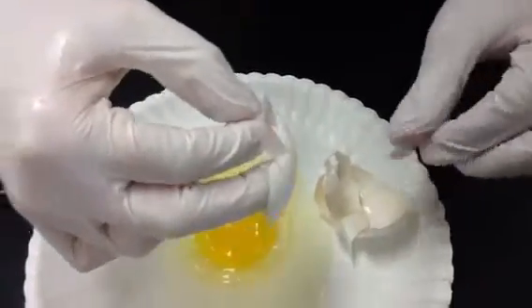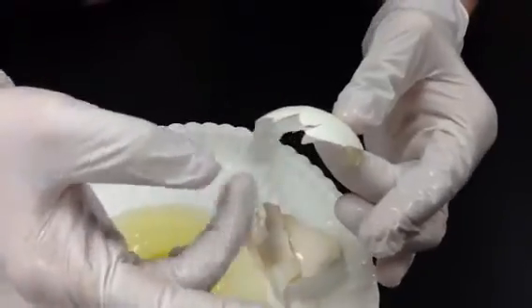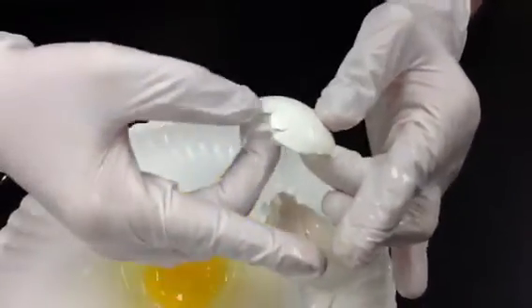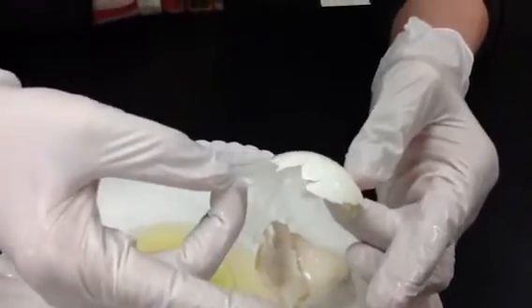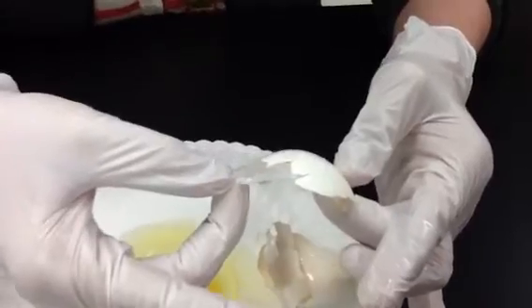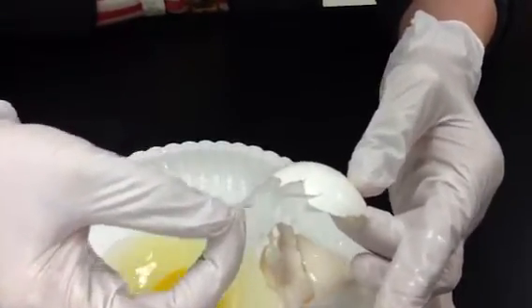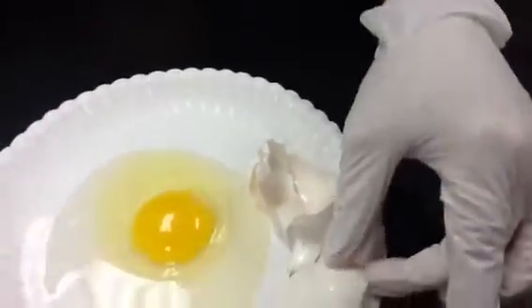And I need you to identify with your partner what that's called. So we have the shell, and then we have this kind of filmy part that's left over. Again, this is part of the egg, and this is the part that sticks to the embryo if we don't have very good humidity during the incubation process and the hatching process. So with your partner, identify what that's called. We already mentioned the name of it earlier in the video, so if you need to go back to identify that, go ahead and write your answers down with your lab partners.